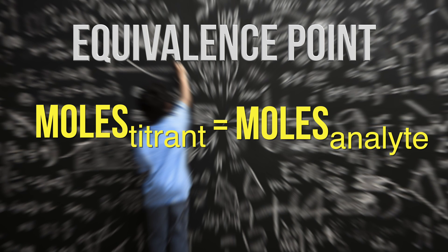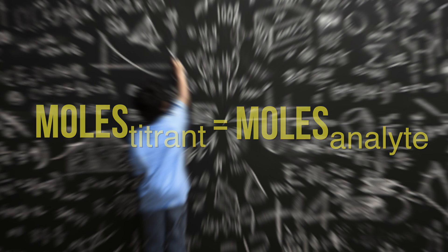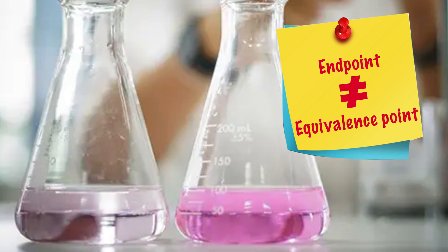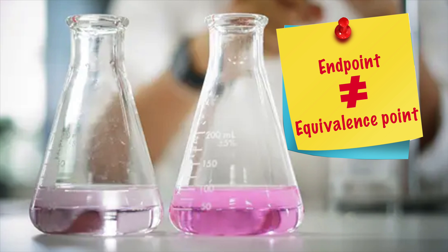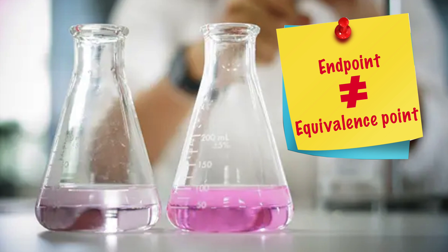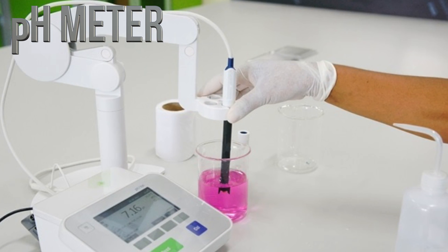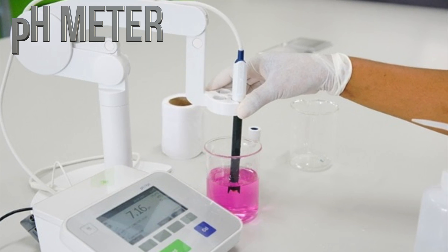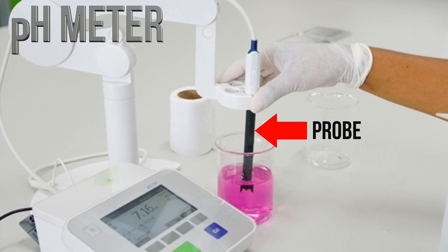In a titration, when the moles of titrant added are equal to the moles of the analyte, this is called an equivalence point. At the equivalence point, a neutralization reaction is completed and neither reactant is in excess. Note that while an accurate indicator changes color as close to the equivalence point as possible, it indicates when a particular pH value has been reached, not the equivalence point itself. We can also use a pH meter and a probe, which gives a digital reading of the pH. Electrodes are typically used as probes to measure a potential difference between the analyte and a sample of a fixed pH — a quick and accurate way of measuring pH.